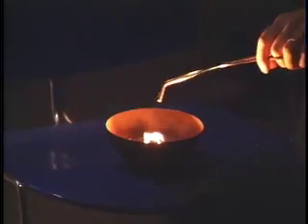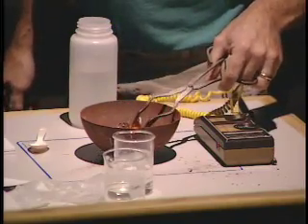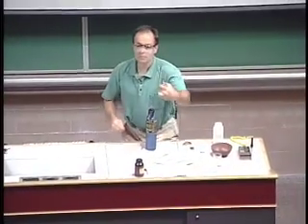There goes the main reaction. Now I want to keep my tongs here. Remember what one of the products was — it was iron. It's molten iron. It's not quite molten, but it's still red hot. It just totally fried the crucible — it's a porcelain crucible. That was molten iron. It actually got hot enough — it released enough heat to liquefy the iron. I can put this under the camera and show you. So this porcelain crucible is toast, but that piece of iron is still glowing. There was so much heat released from that. But it's exactly the same amount of heat as is being released by this oxidation of the iron tweezers.